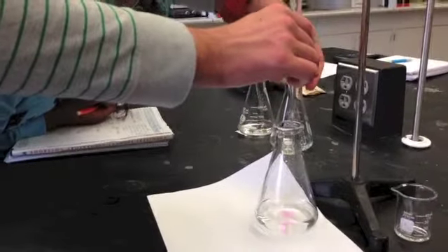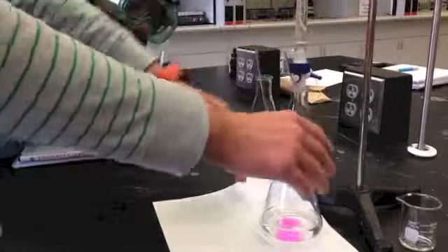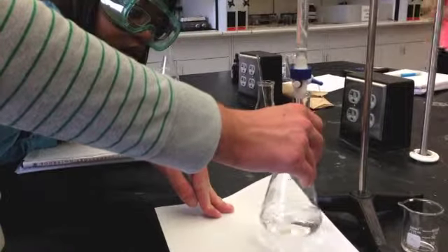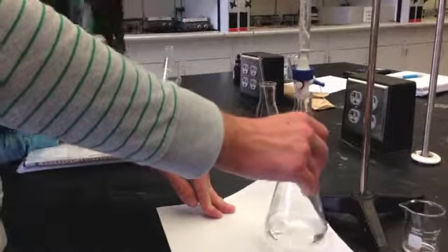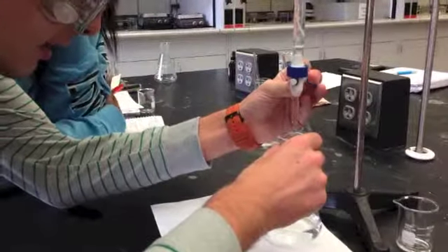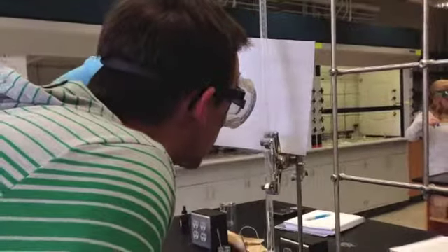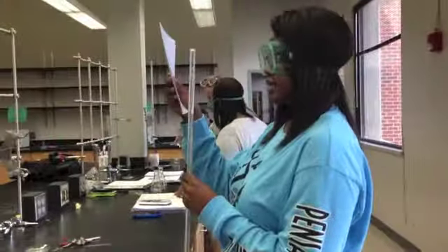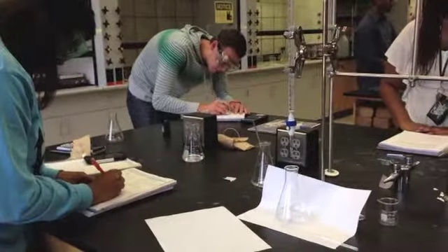In this experiment, the analyte is the sodium hydroxide solution and the standard is potassium hydrogen phthalate, otherwise known as KHP. The sodium hydroxide is added dropwise to the Erlenmeyer flask from the burette until the endpoint is observed. The volume of the sodium hydroxide dispensed must be determined by difference. Read and record the initial and final volumes to 2 decimal places.